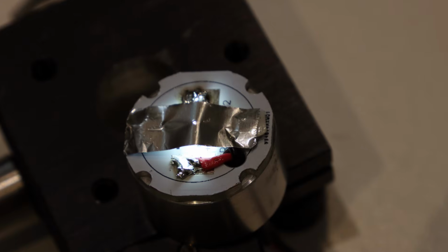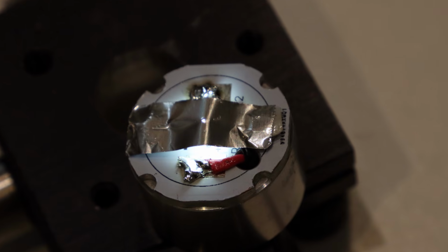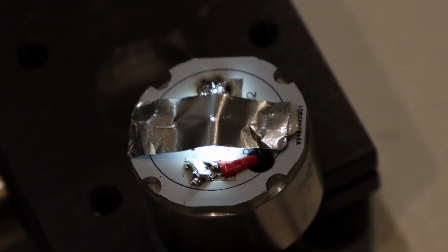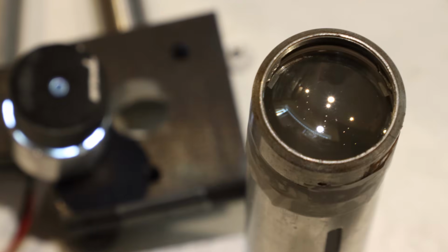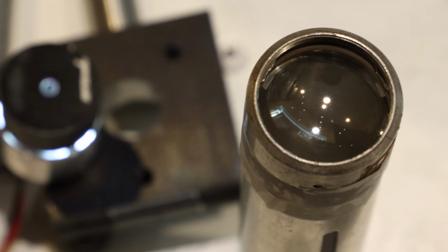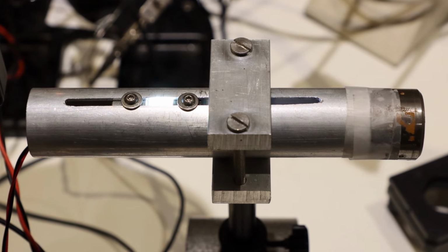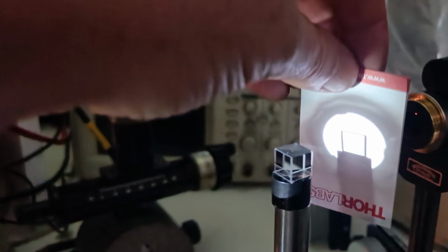So with this configuration in mind, building a spatially coherent white light source is actually not that difficult. We just need a broadband emitter, such as a white LED, and place a tiny pinhole in front of it. Here the pinhole itself was made from a piece of aluminum foil in which I punched a tiny hole, and this pinhole was then glued in front of the LED. The lens I used is an achromat with a focal length of 90 mm. The emitter was fixed in a tube and the position of the pinhole was placed exactly in the focal plane of the lens, creating a strongly collimated beam. And this source produces spectrally broad light that is spatially coherent.